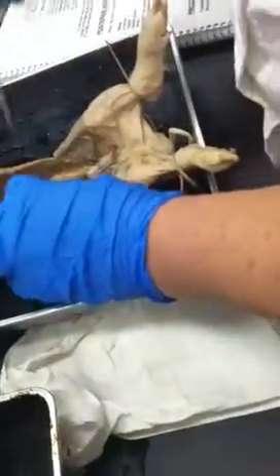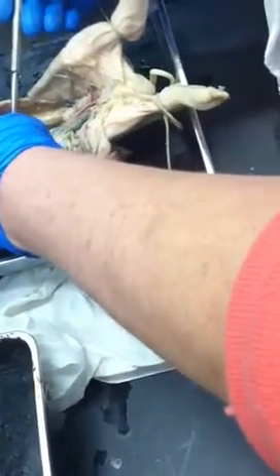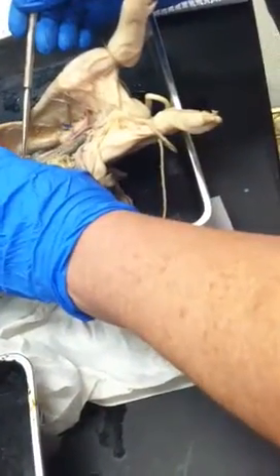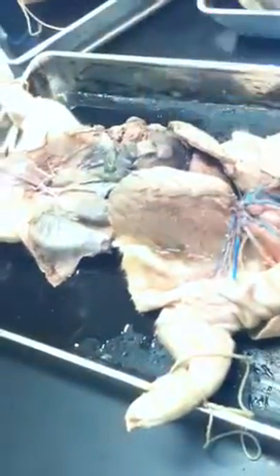On this side, same thing. This one, the colors aren't quite as deep, but you're looking for that vessel here. This one has a bigger space between the celiac and the superior mesenteric. So there's almost like a centimeter. This one, they almost come off one and then the other. So there's some individual variation here, but it's where they're going to.